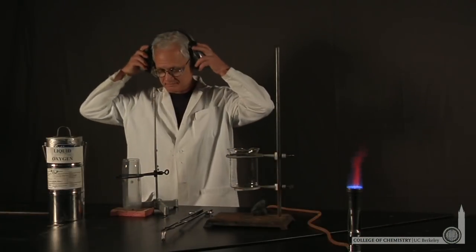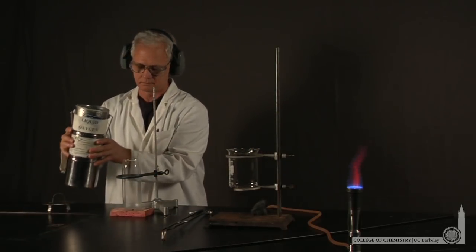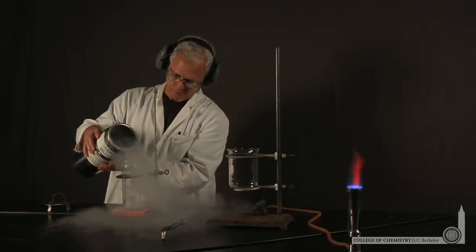We've asked Lonnie to demonstrate the formation of iron oxide, or rust, but rather than just sitting around and waiting for rust to form on iron, Lonnie's going to do it the rapid way.